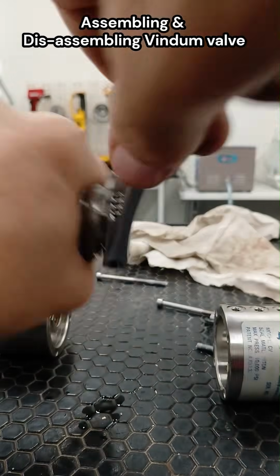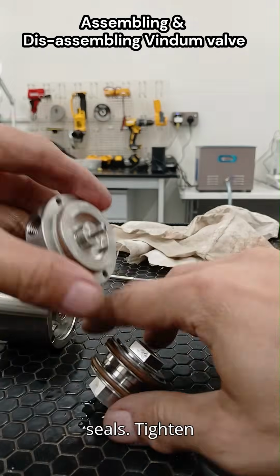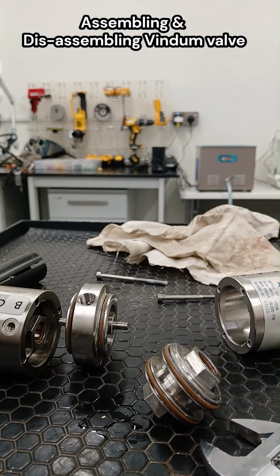Five, reassembly. Place the rotor back in the correct orientation. Align housing parts carefully to avoid pinching seals. Tighten bolts evenly and to specified torque. Reinstall the handle or actuator.